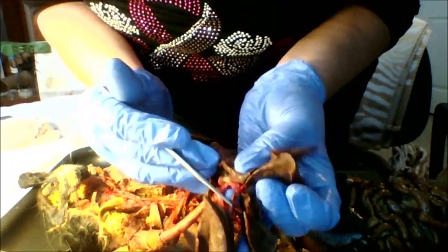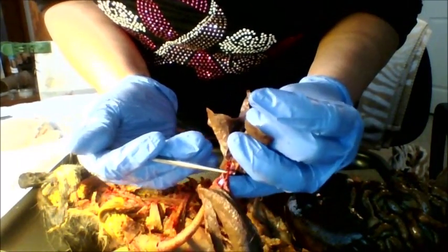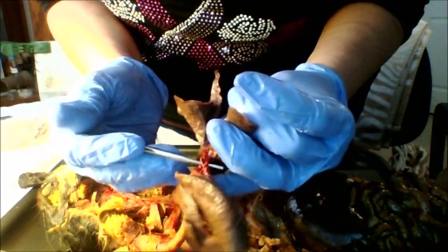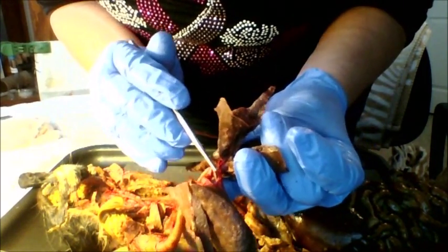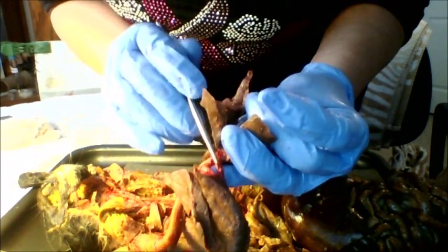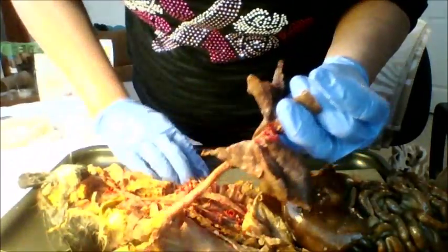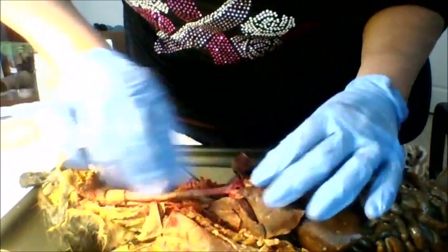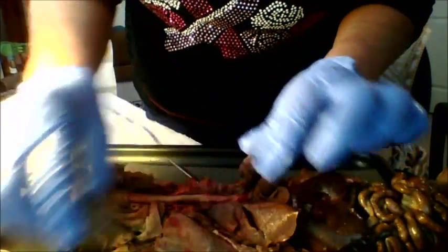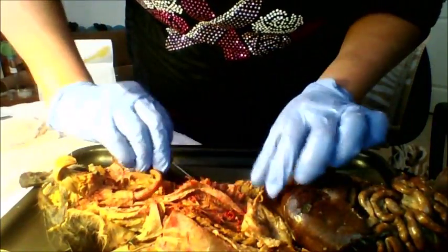And you can see right here, these 2 vessels, these red vessels, these are the pulmonary veins. This is where the oxygenated blood returns from the lungs to the heart. So our lungs would be here, our heart would be here. Just took the heart out for ease of demonstration.